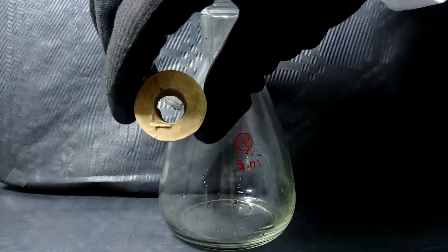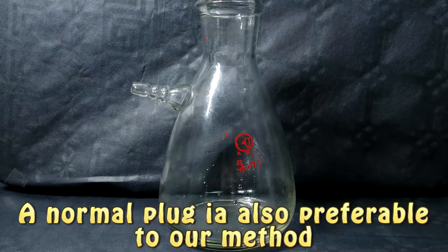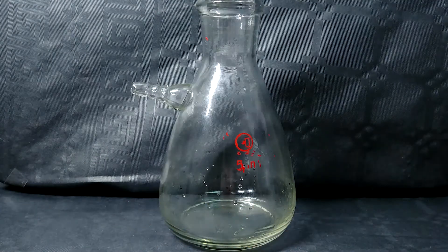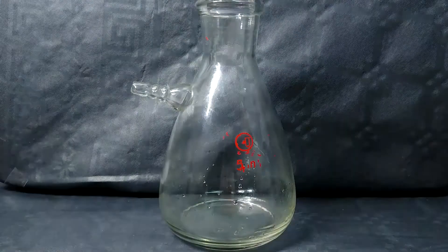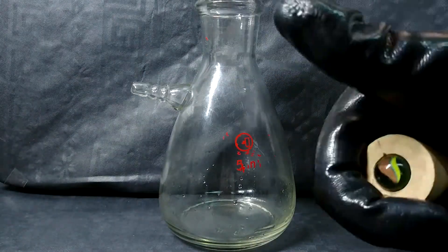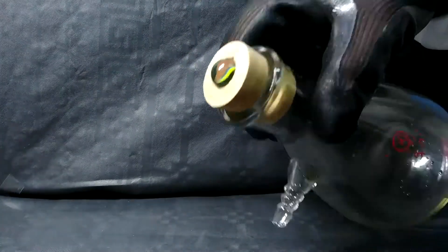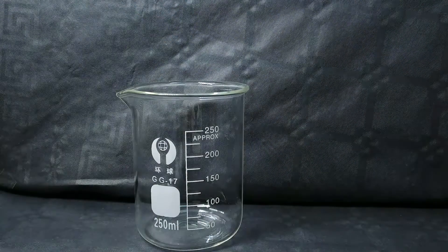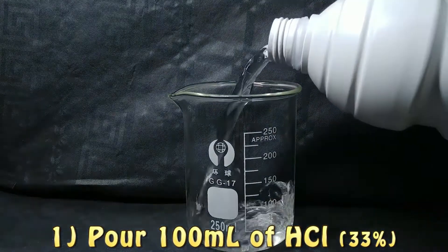So the first thing we are going to do is take a conical flask, which is a bit particular because it has an upward-facing aperture which we are going to plug in order to not let the gas we are going to produce escape. Then we are going to pour some muriatic acid into a beaker and then put it into our conical flask.